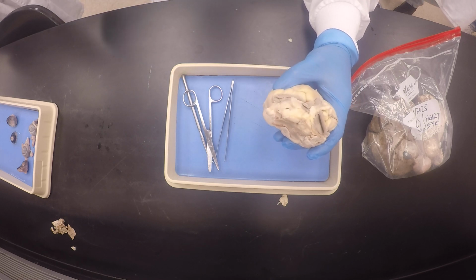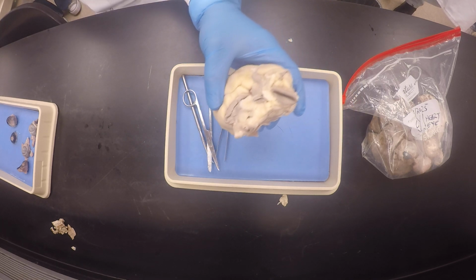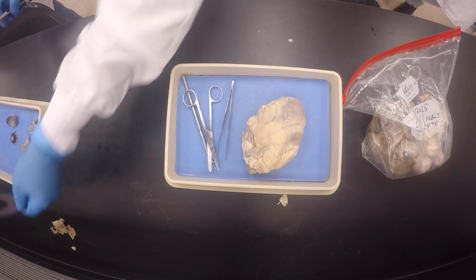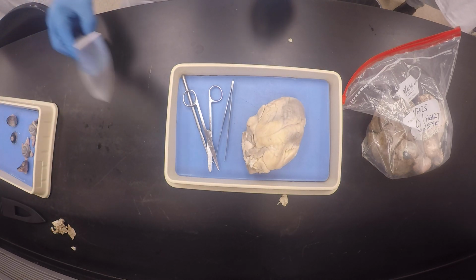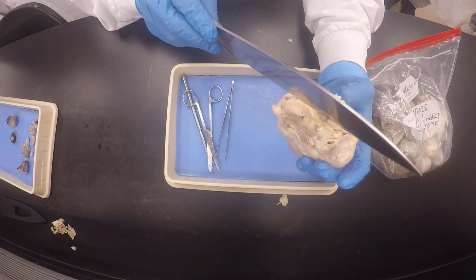So that, and then my good friend, I'm gonna go ahead. Sorry about that. I'm always talking about Game of Thrones. I don't know if you guys watched it. You know how they take the sword from the sheath. So this is one of those big knives. So I'm gonna gauge like this. You see what I'm saying?